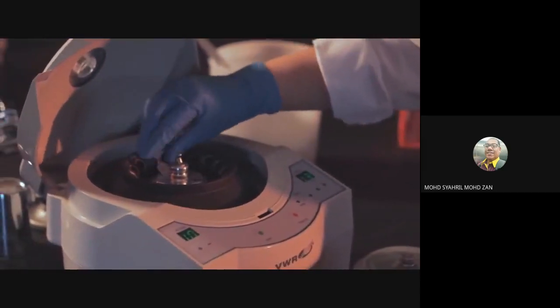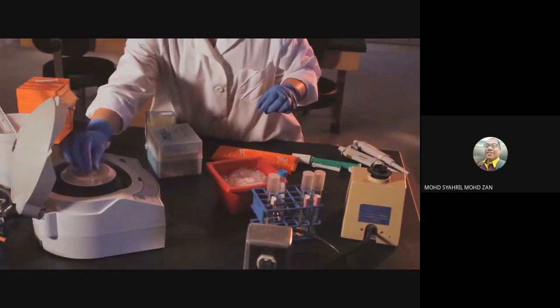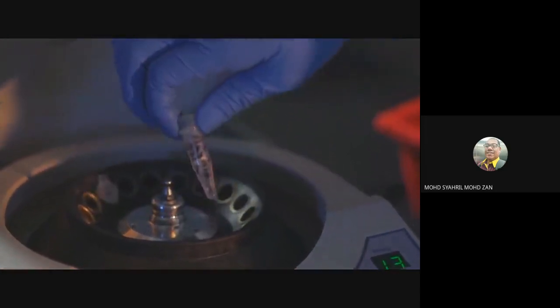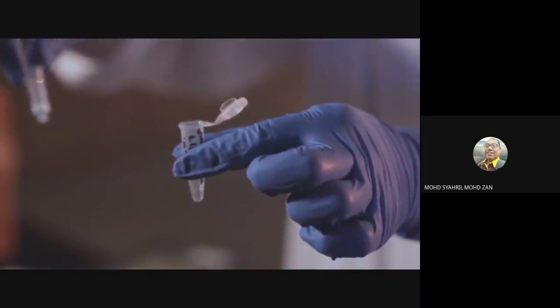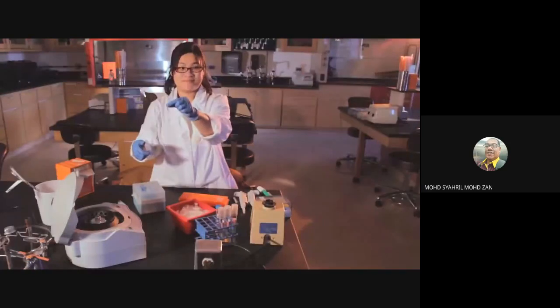The microfuge tube caps will not close, so be sure that the caps are facing toward the center of the centrifuge so that they do not break off while spinning. After centrifugation, you should see about 50 microliters of clear, colorless liquid in the bottom of your microcentrifuge tube. This contains purified plasmid DNA. Discard the spin column, but keep and store your tube of purified plasmid DNA.